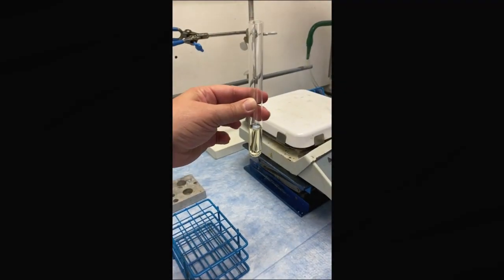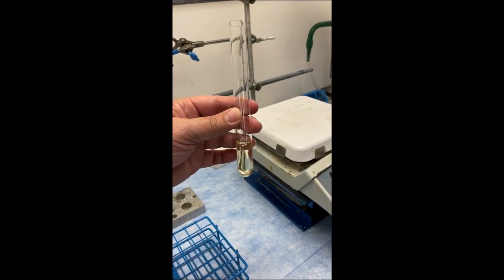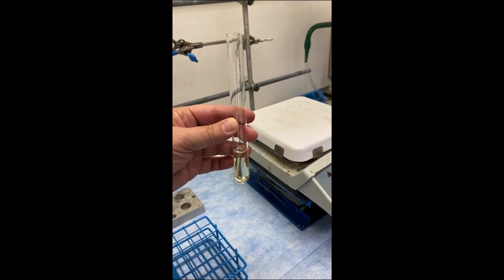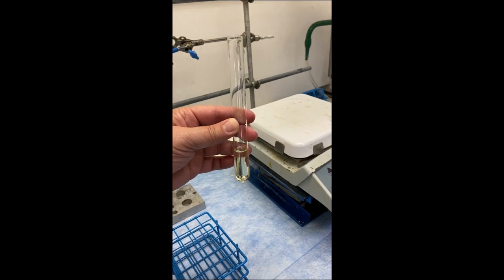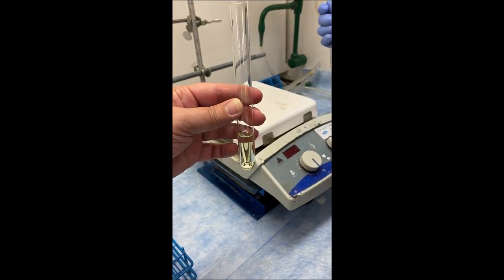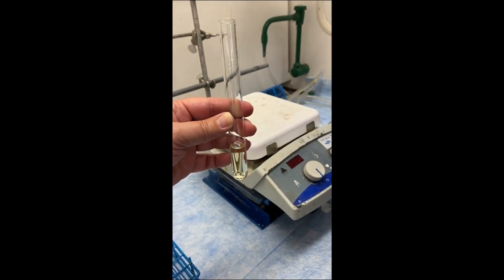Right now we have methoxybenzaldehyde and acetophenone dissolved into 3 mLs of ethanol. What we're going to do now is add the sodium hydroxide, and this is the point where we deprotonate the acetophenone — specifically the alpha hydrogen on the acetophenone.